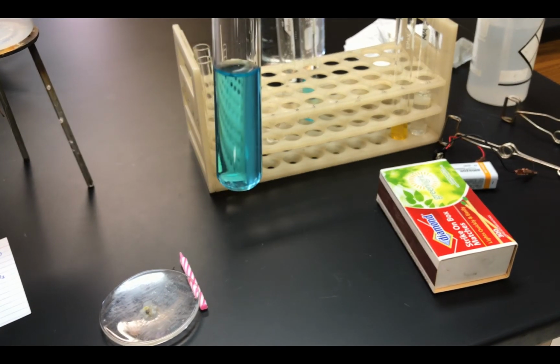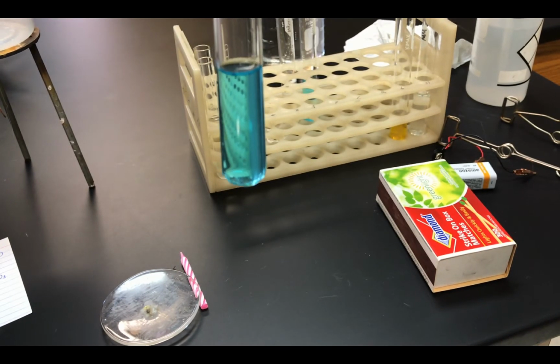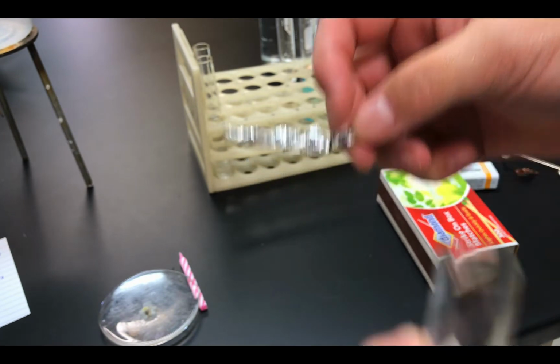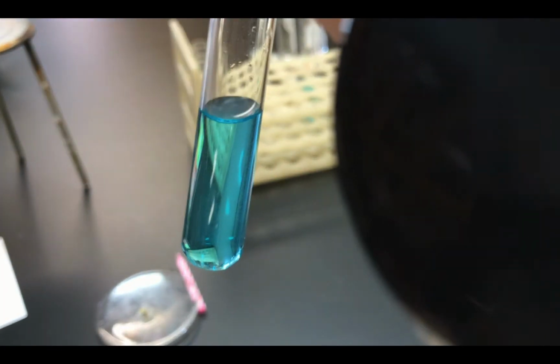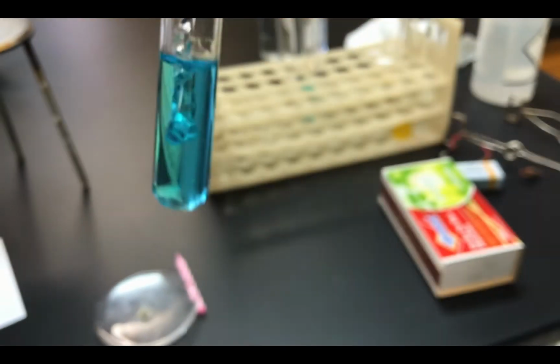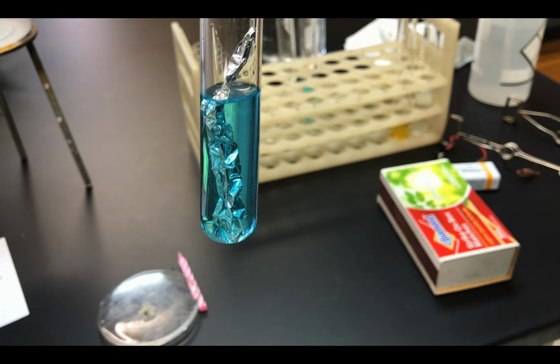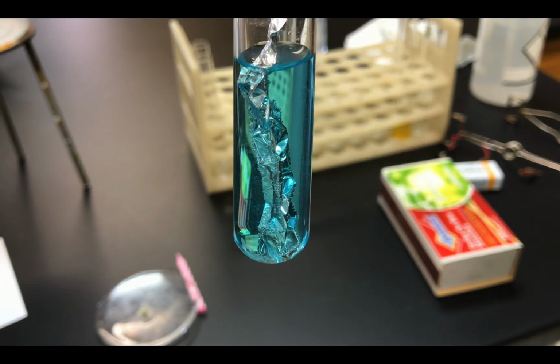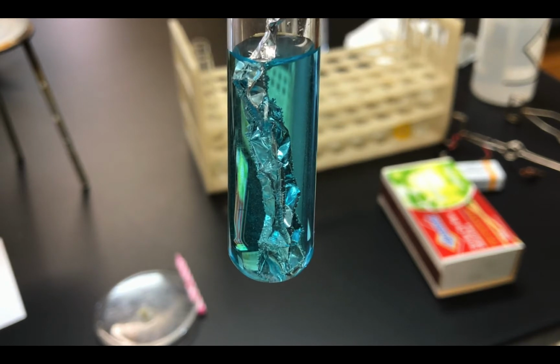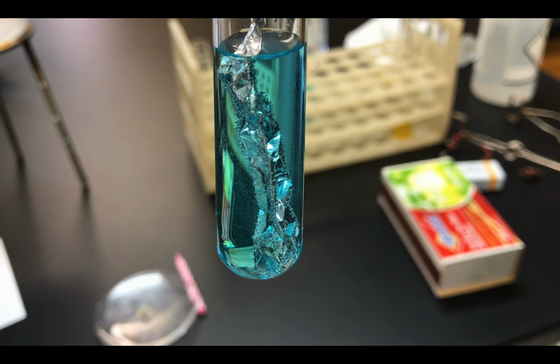Now that we have aqueous copper 2 chloride, we will go ahead and add our piece of aluminum. And now if we observe, we'll see that it appears as though nothing is happening, but we will keep watching and we will be thorough in our observations about things like time and the things that we see. And remember, we should record all the things that we see so that we can reconcile them with our written reaction and all the things that we know. So take good observations.